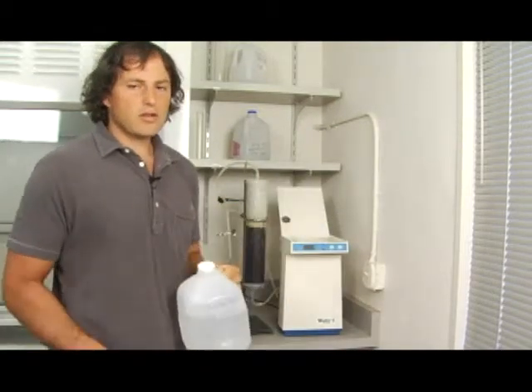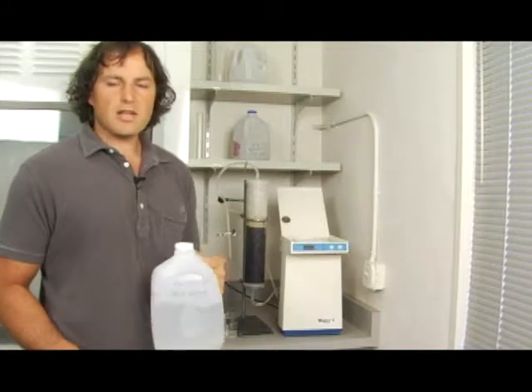If this container here is empty, talk to your instructor and they'll give you a container with pre-filtered water.